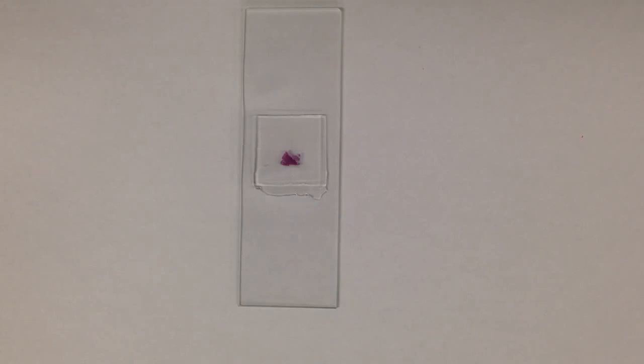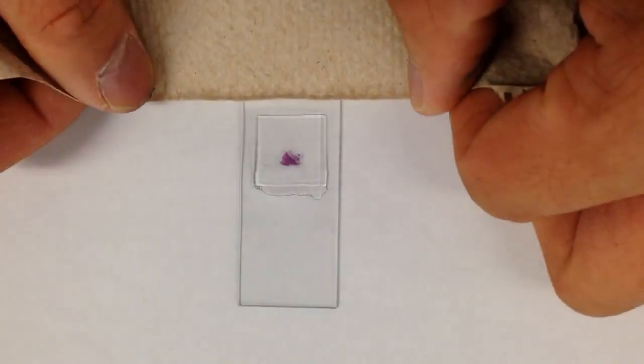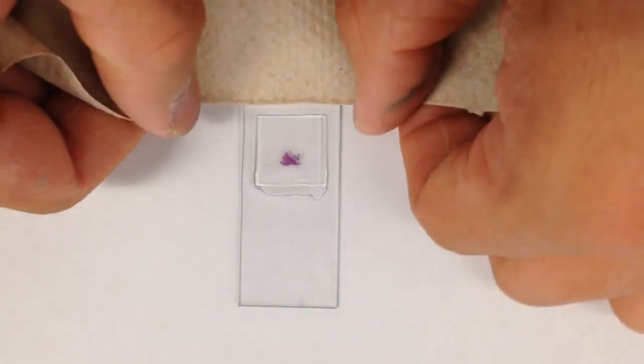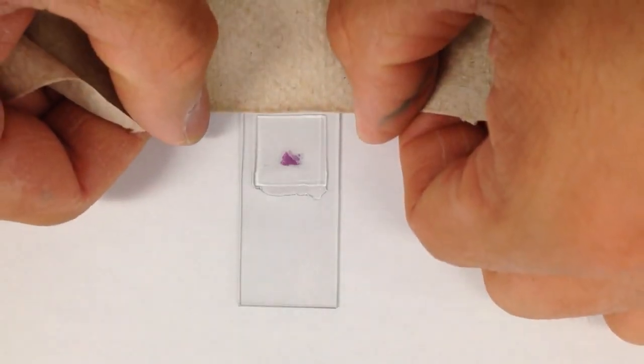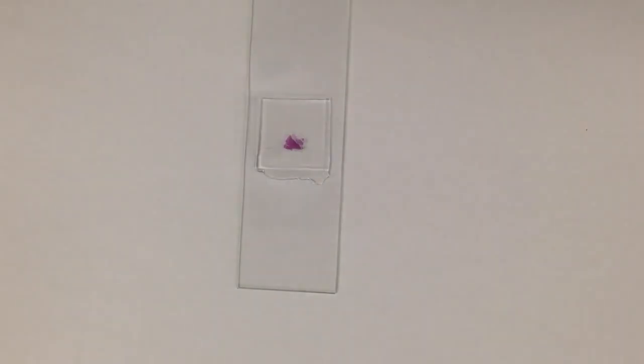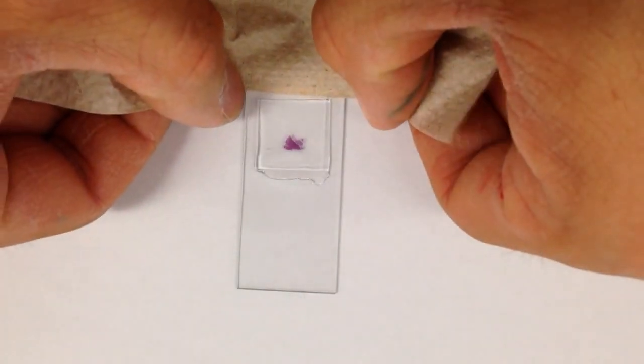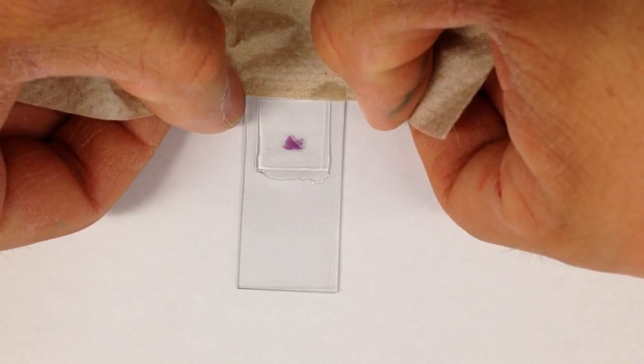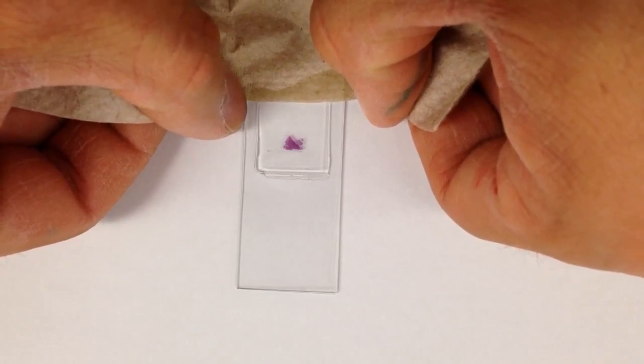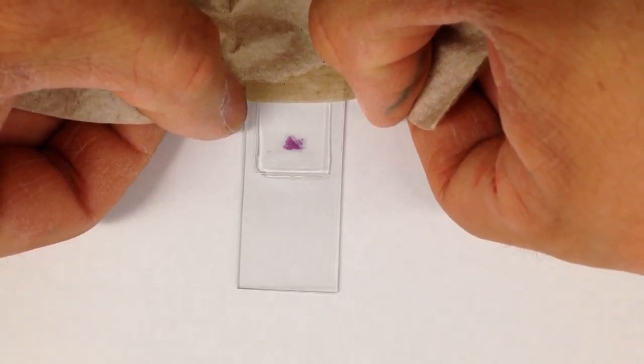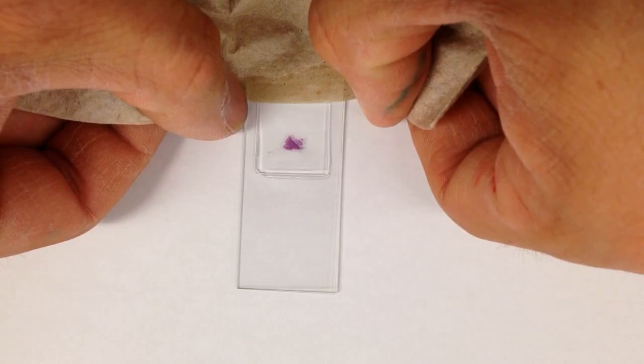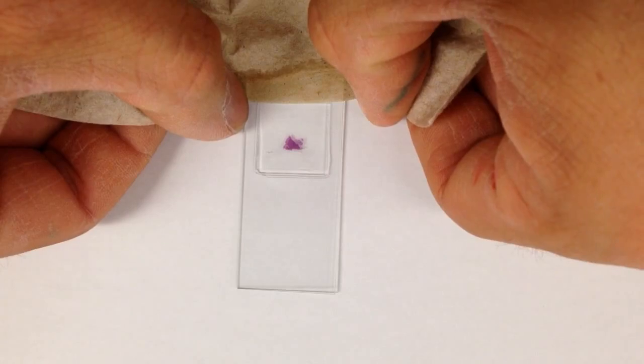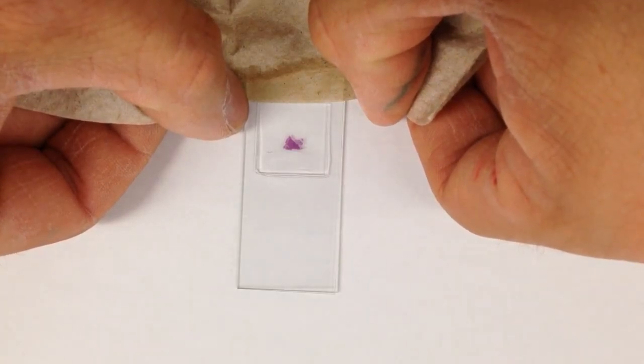And then what you're going to do is take a paper towel, take the edge of the paper towel, put it on the opposite side of the drops because you don't want to wipe up your drops, and make sure you get a nice thin edge. The point is to have the water come across, and as you can see, the salt water is being pulled into the wet mount underneath the cover slip. So you want to hold this for a while until the water stops moving into the paper towel or until you don't see any of the salt water on the side.